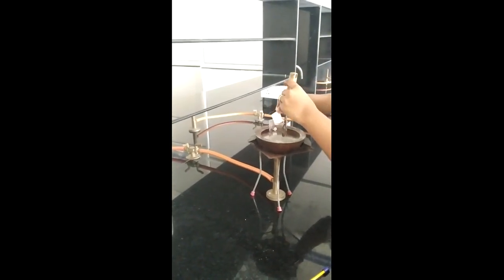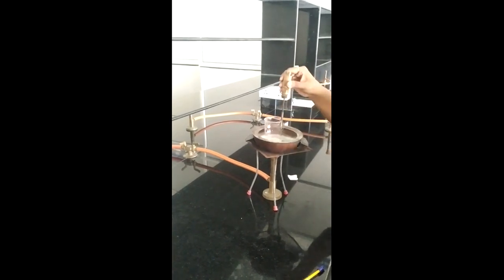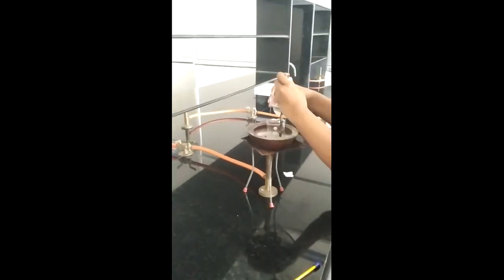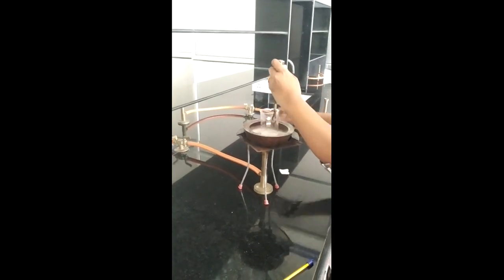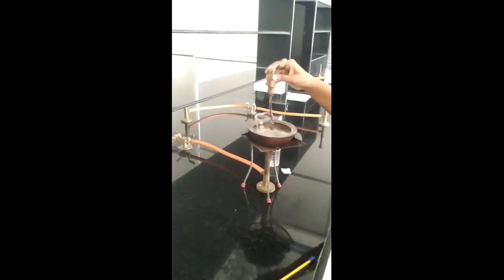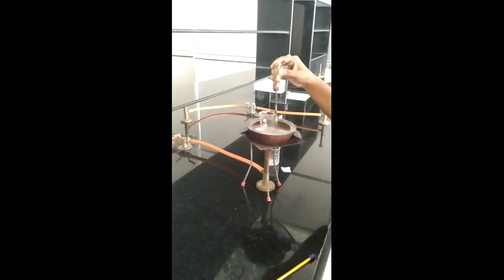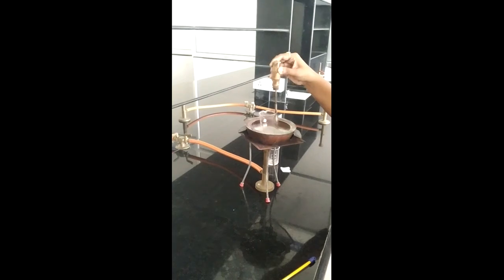Now I have added the sodium lauryl sulfate into this liquid cetosteryl alcohol. After that I am going to add the purified water into it. So now this becomes the solution of cetosteryl alcohol, sodium lauryl sulfate and purified water.